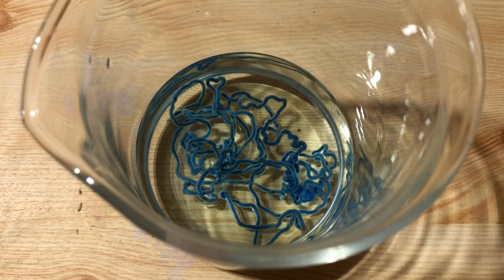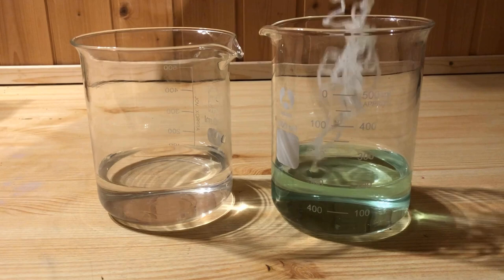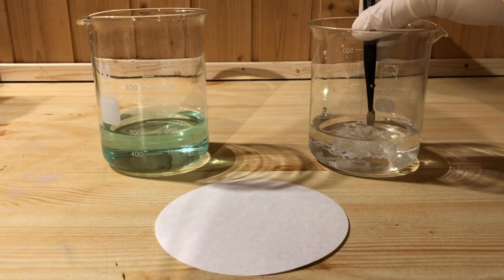Once the synthetic silk thread is completely decolorized, it is briefly washed again in distilled water. Finally, it is placed on a filter paper to dry.